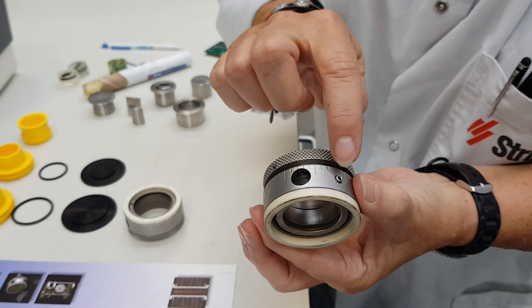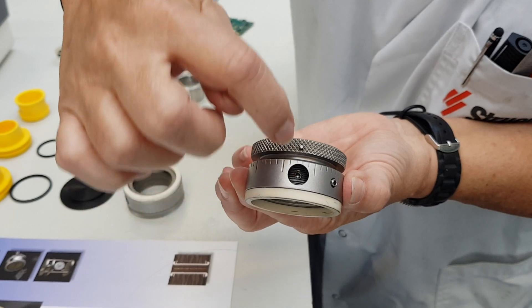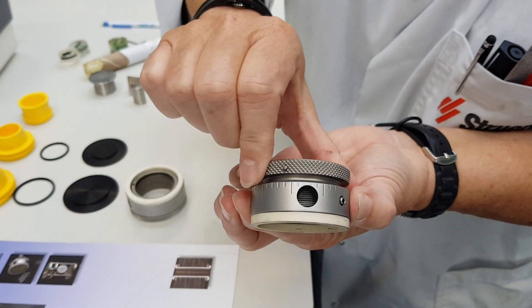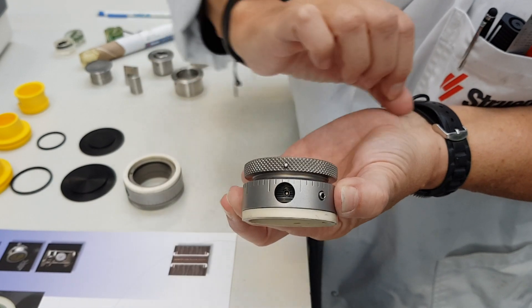There are some screws. Inside here there is a screw to hold and fix the sample. It is at the same level as this dot up here, so you can always see where you are. This one is to fix the thread and to fix the positioning of the sample.